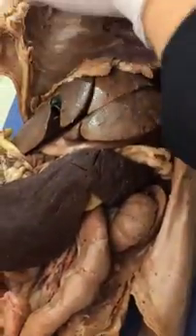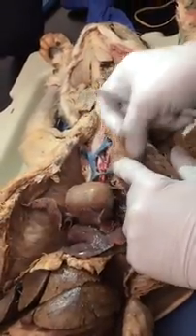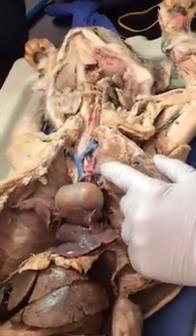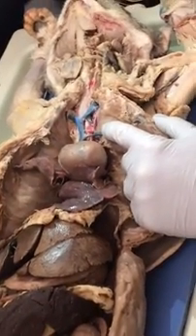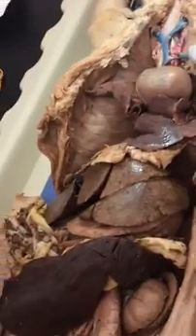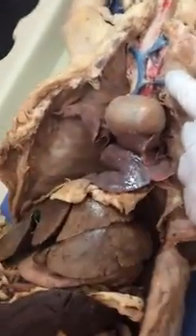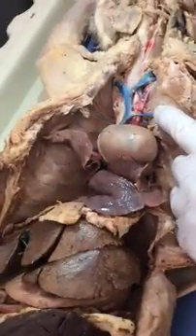Okay, what else, girls? Sternal vein, where would you pin that up? Right here. Probably pull it up. Okay, somebody still has theirs attached. It broke. Which one? Sternal. Does anybody still have a sternal vein still attached to the sternum? One right there. Okay. So I try to find one that's still attached.